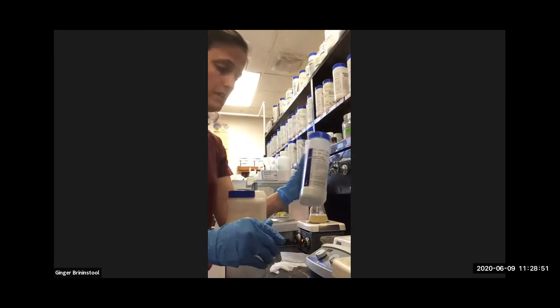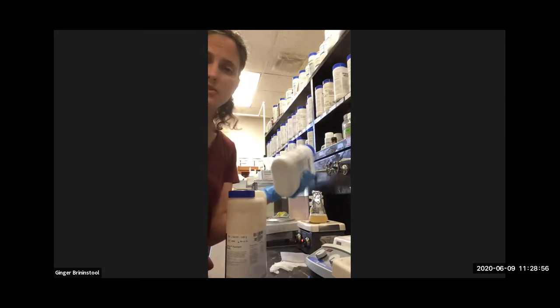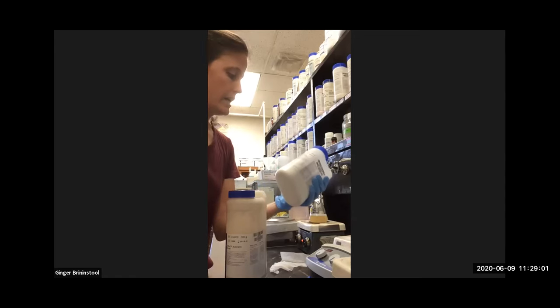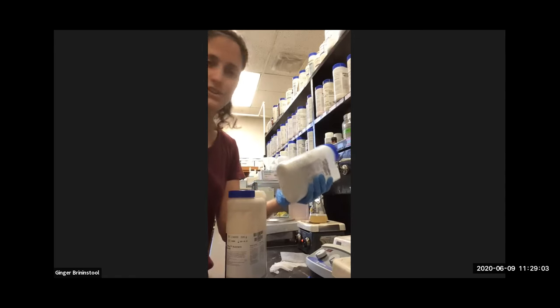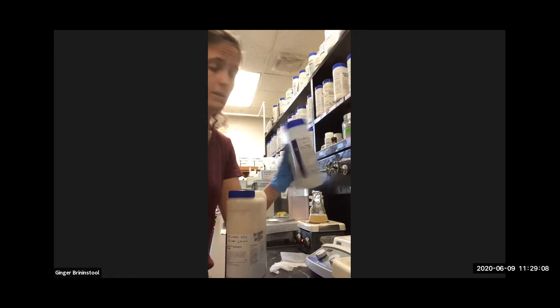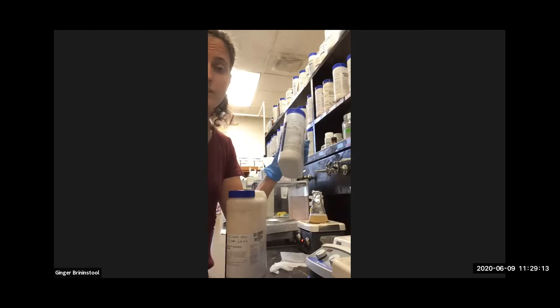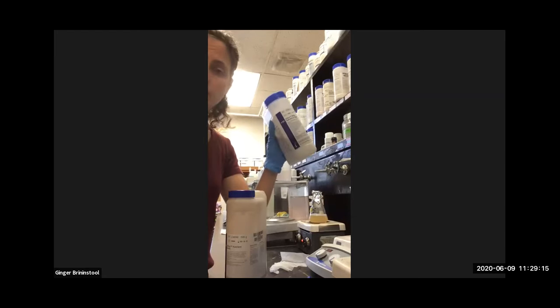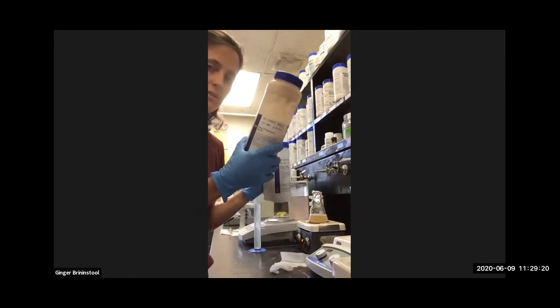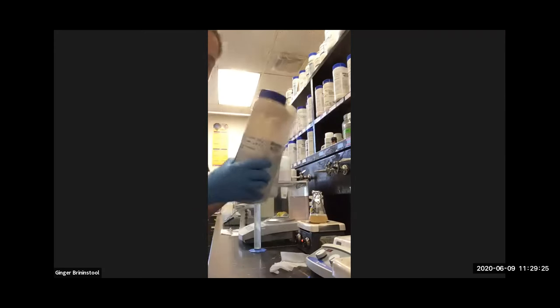So different growth mediums are needed for different organisms, and Streptococcus species are super picky. We refer to them as being fastidious, and we're not cursing at them. We're just recognizing that they have really specific growth requirements, and so we like to provide that for them if we can. If we want to grow them, we have to provide that for them. And something like this would do that. It would allow us to culture Streptococcus, whereas Streptococcus won't grow on this. It's too general of a media, not specific enough.